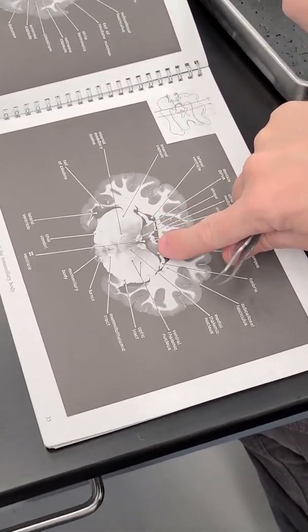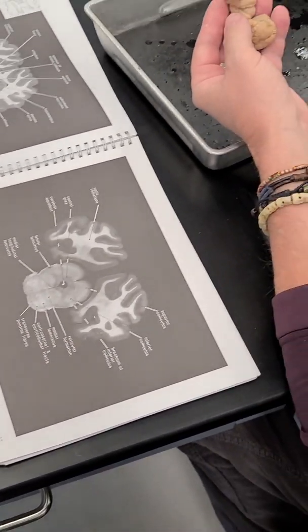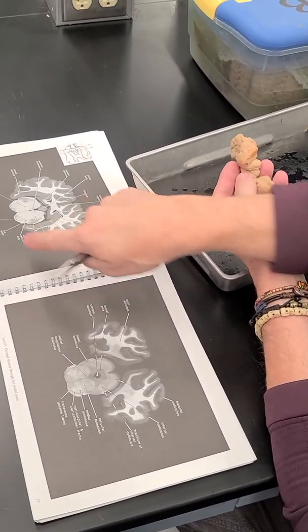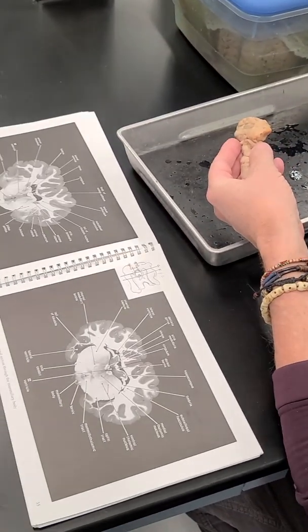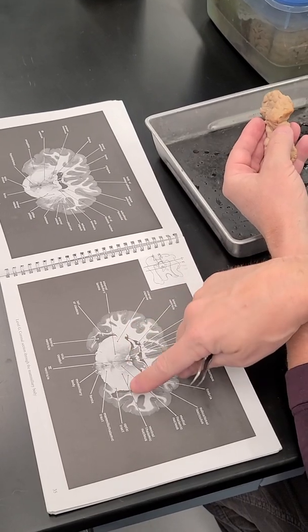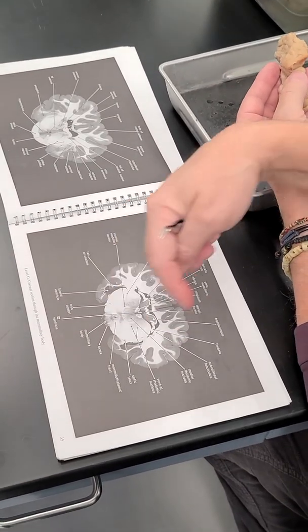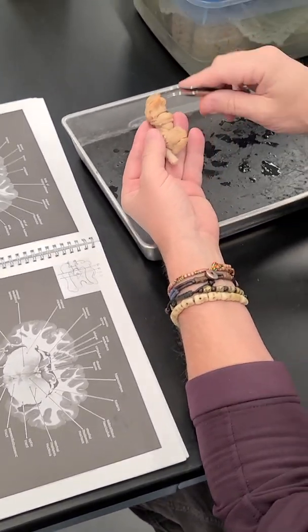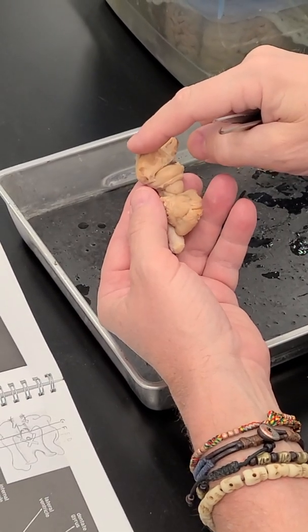Here you can see the cranial end of it, or rostral end of it. And then here it's cutting through the part that loops around. And so you see the hippocampus is this big elongated structure. And if you move back forward again, you can see the hippocampus ventrally. Actually, this is probably the amygdala, but you can see the tail of the hippocampus depending upon where that structure is. So this is the hippocampus here, and the hippocampus is modified cerebral cortex.